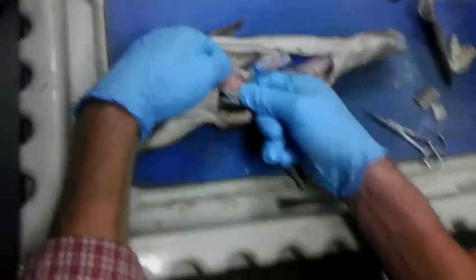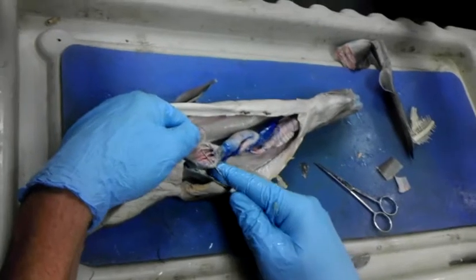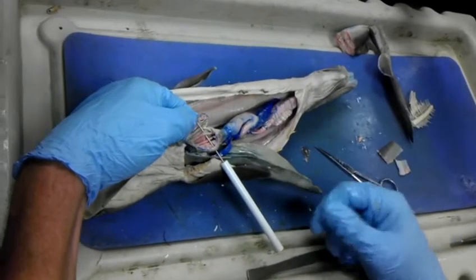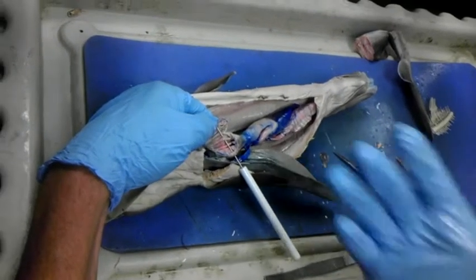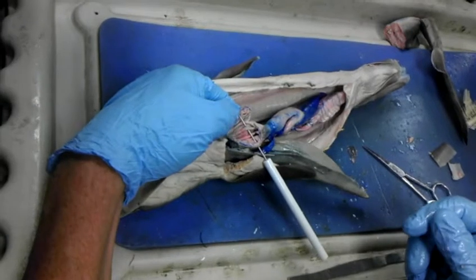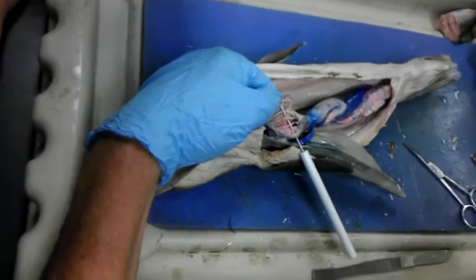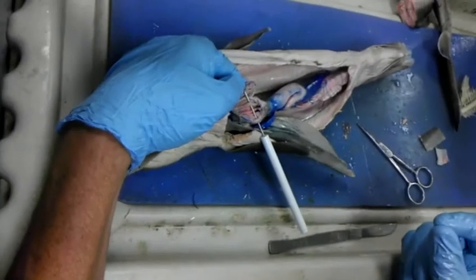So that's rugae. So on the exam, if we have this pinned, you would identify, again, it's a stomach. Actually, you could write down shark, right? What is this pinning? It's a shark, but that's not what we're asking for. We're also not asking for stomach either. Because what's the rule when it comes to identifying a pinned item? The smallest identification.